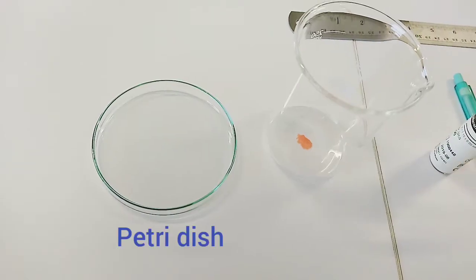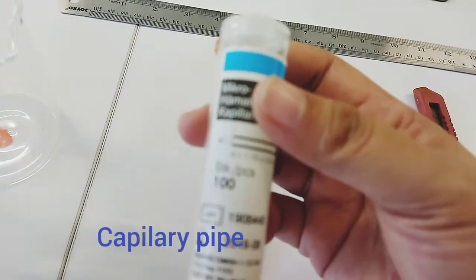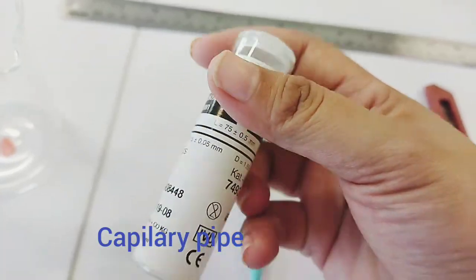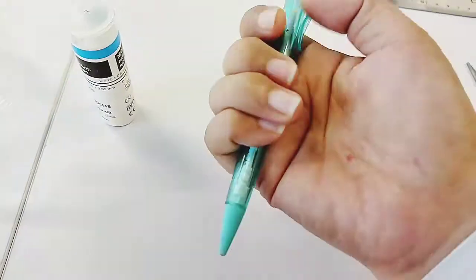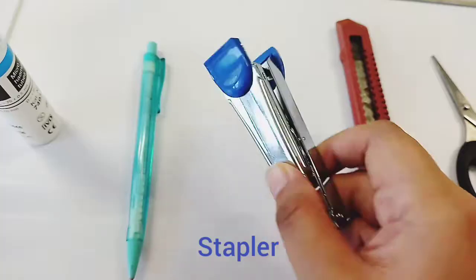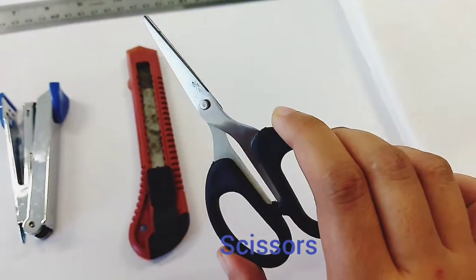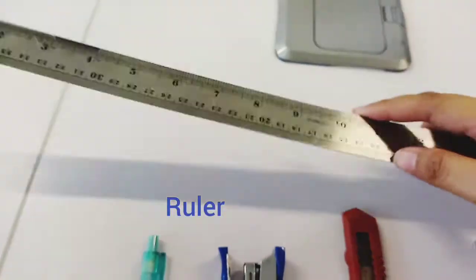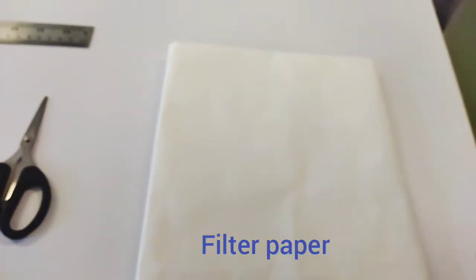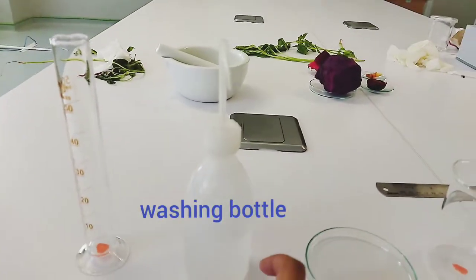We need some simple laboratory tools. They are petri dish, beaker glass, capillary pipe, pencil, stapler, cutter, scissors, ruler, filter paper, measuring cup, and washing bottle.